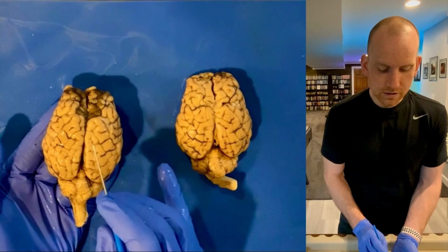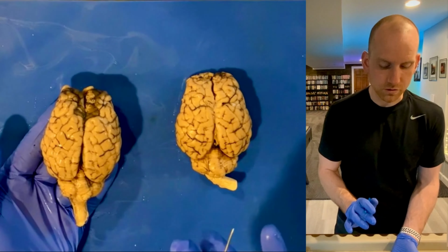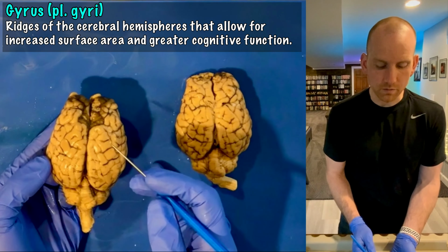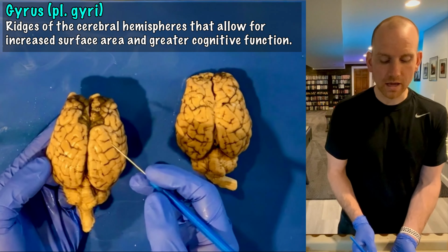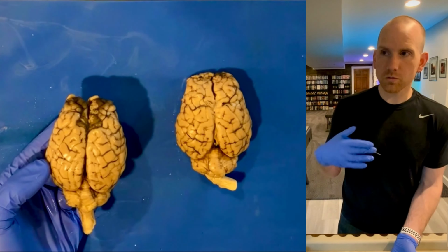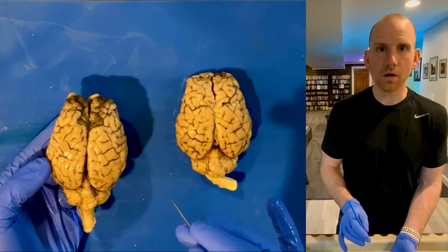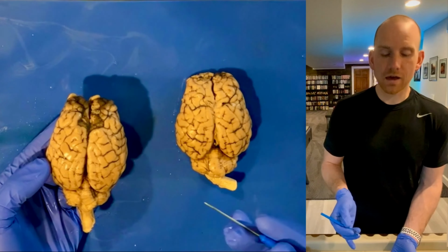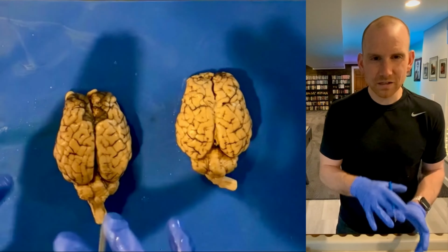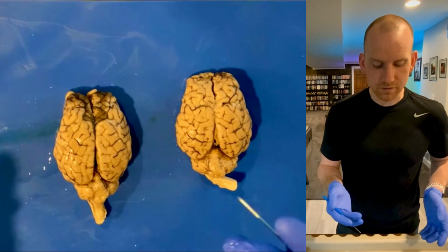So the ridges, the things that are coming up, like the folds, the worm-like structures, are actually called gyri, or a gyrus would be a single one of them. Gyrus. And the way that I always tell students to remember it is it actually comes from the same Greek word that gives us euro, or hero, however you pronounce it, gyro, that you might have if you've ever been to Taste of the Windy City or another Greek restaurant. That little pita folded, wrapped sandwich that often has lamb meat and stuff in it.